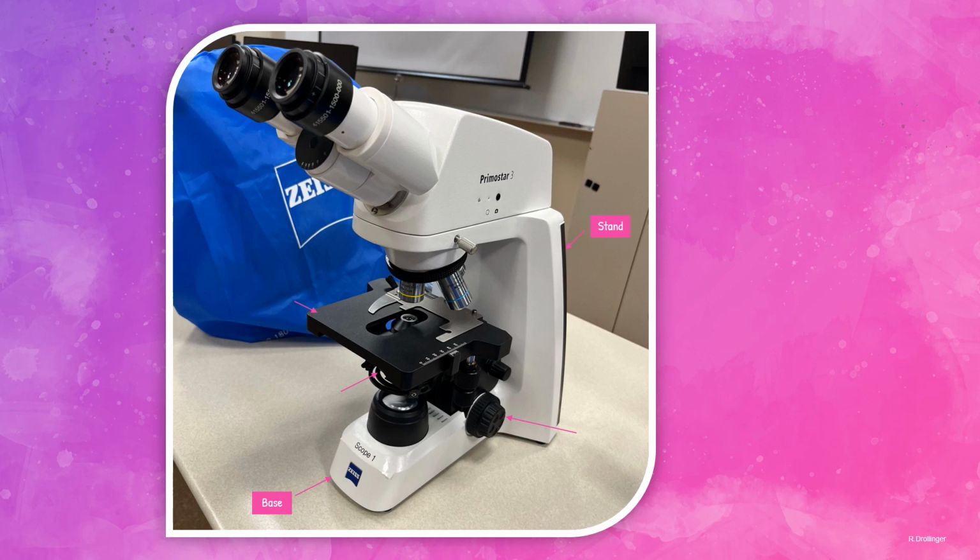This particular microscope is integrated with a fully digital classroom, and it's connected to a network, so we don't move these around in the laboratory. But if a microscope does need to be moved, one hand needs to be on the base, and the other hand needs to be on the stand for transporting it. Next, we have the ocular lens, which is also known as the eyepiece. I'll talk more about the ocular lens within this lecture, but in short, this is what magnifies the image produced by the objective lens so that it can be seen with the laboratory professional's eyes.